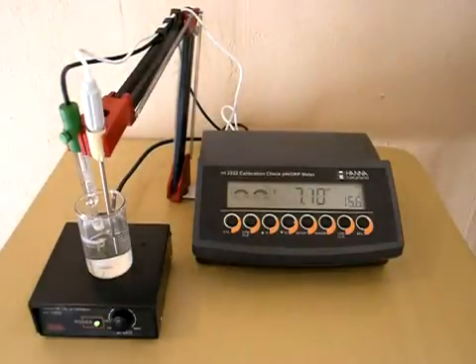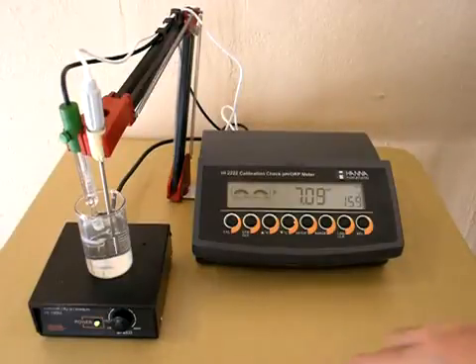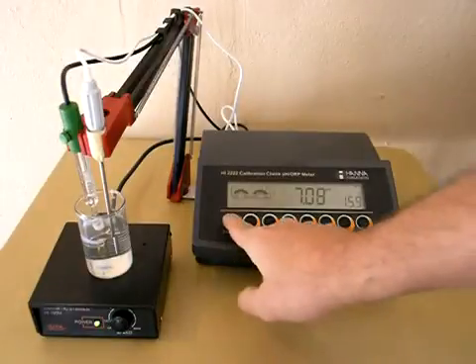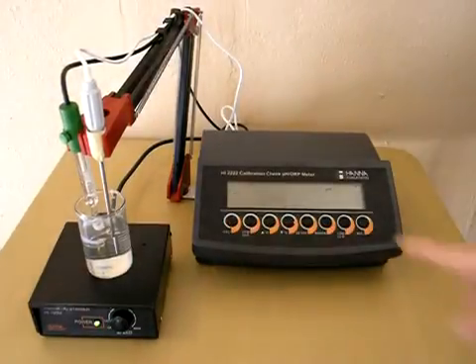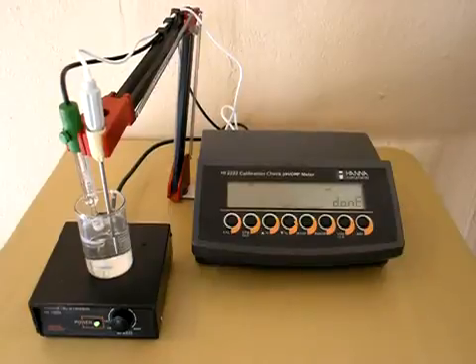If this is the first time you're using a new probe, you're going to want to clear the old calibration. I'll walk through that. If not, you just move forward after you hit cal. We'll hit the calibration button. It'll ask us if we want to clear it, and we'll hit the clear button. That's simple, and we're done.